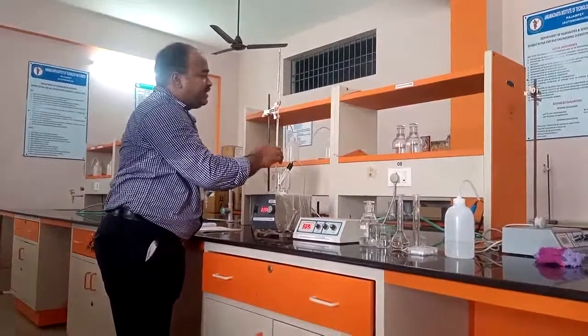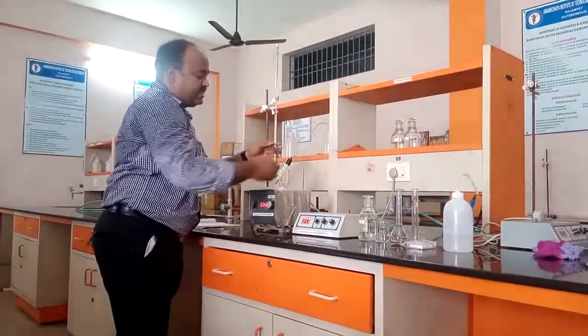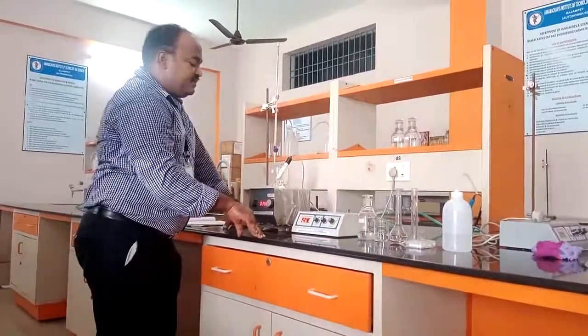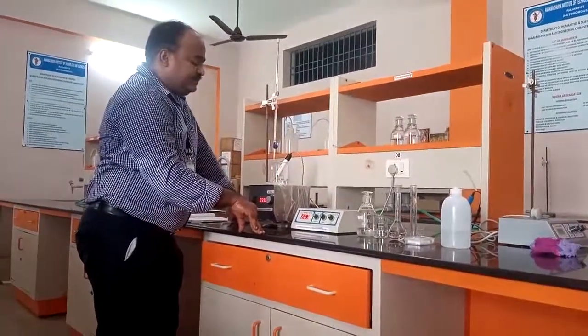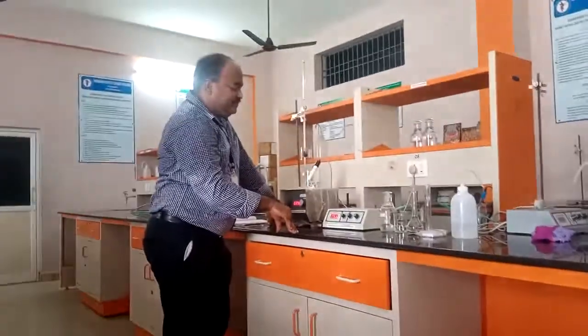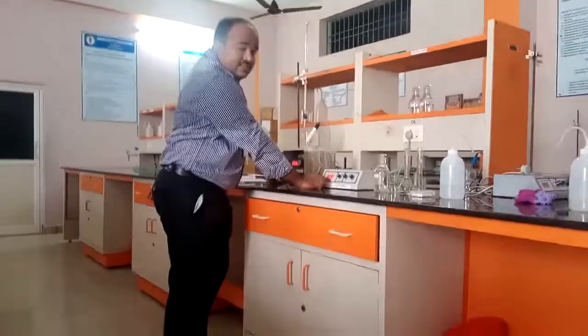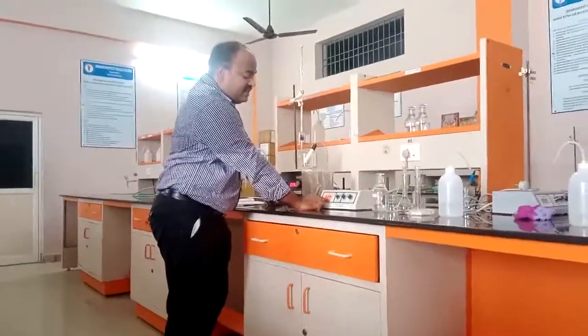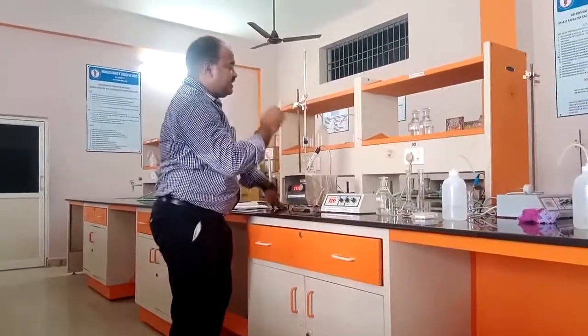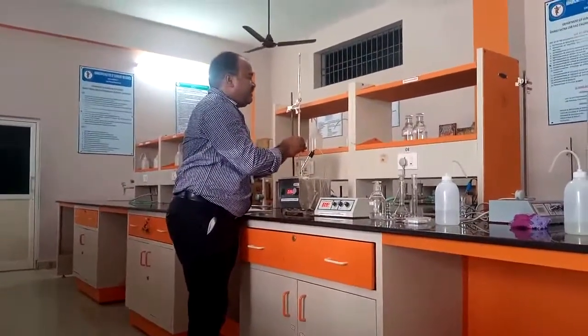It will be a line which is much higher compared to the acid mixture. So now I am adding another 0.5 ml to get until 7. The conductance will reach 7. Okay. Let's see. Now it has reached 6.6. So the OH minus ion concentration is increasing in the solution. Now I will add another 0.5 ml.